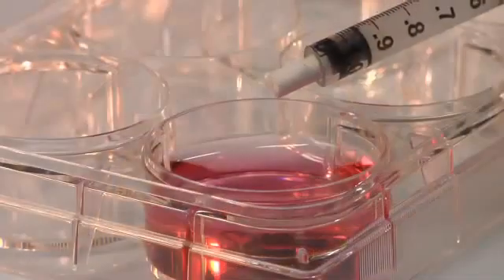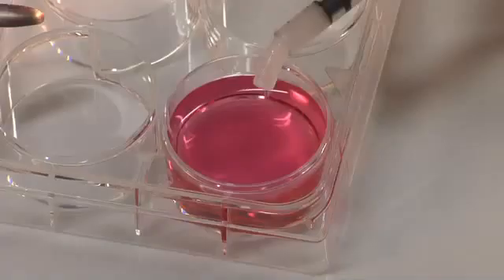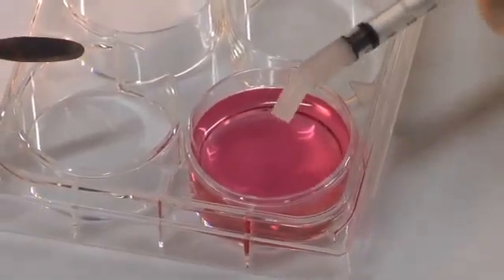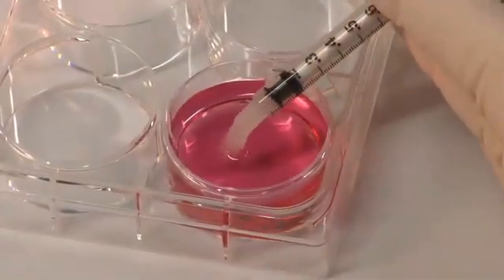We're now about two and a half minutes from the start of the process and we have created a tissue that has form, geometry, composed of biomimetic extracellular matrix molecules and the cells that you just put into it.